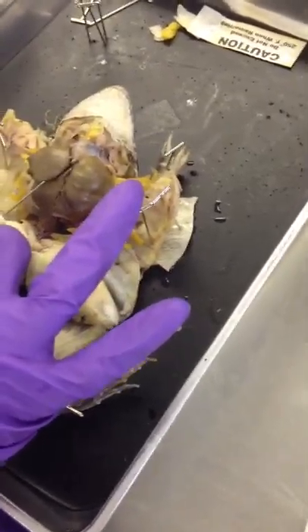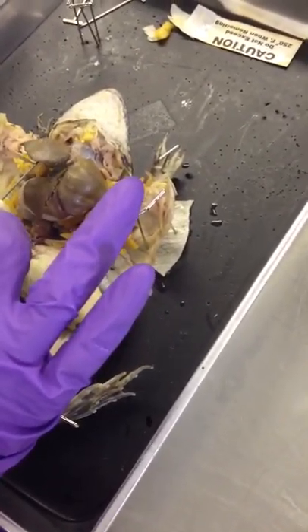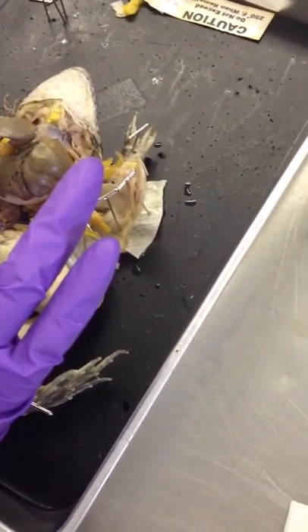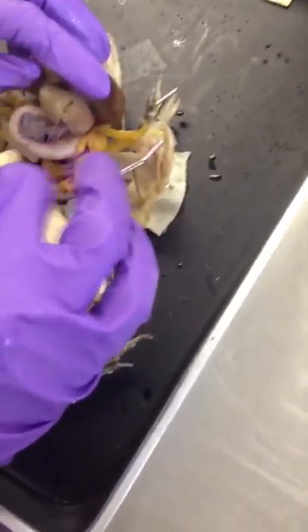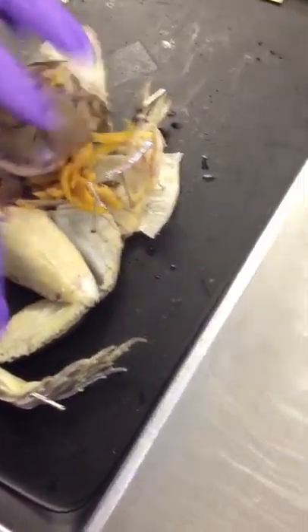So this has to be the liver — which lobe? Right. This is the right side of the frog, so this is the right lobe. This is the left anterior lobe. Next one is the left posterior lobe. So how many lobes of the liver in the frog? Three. Only three.